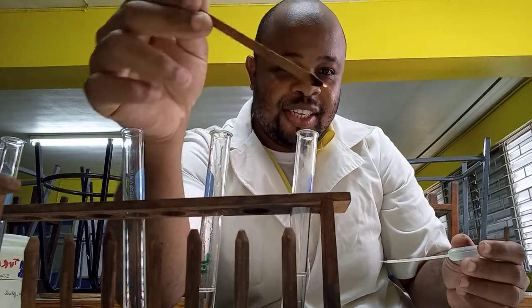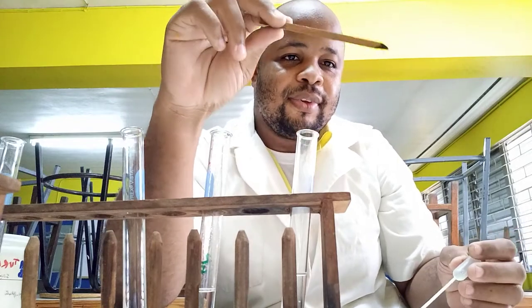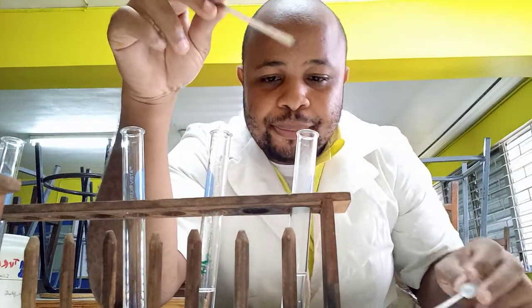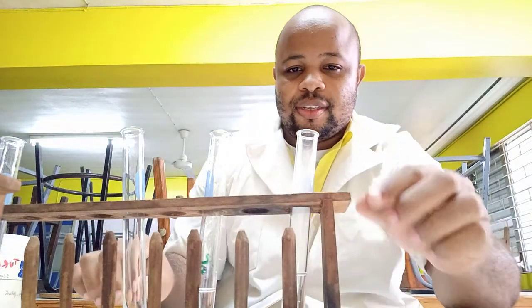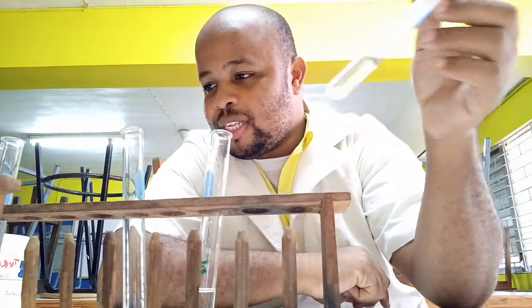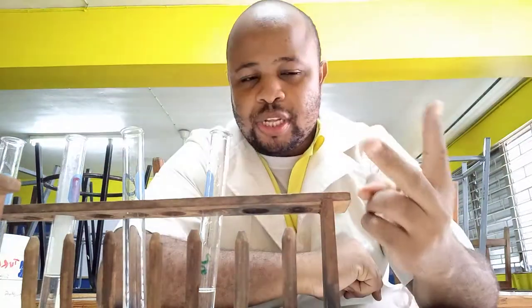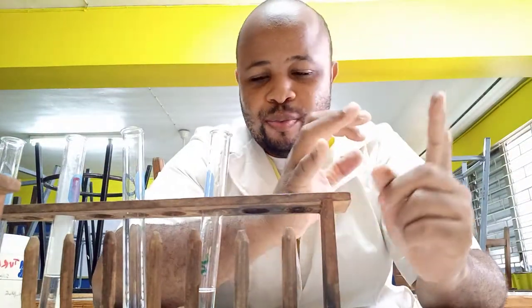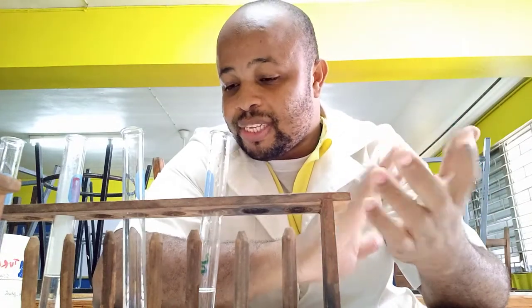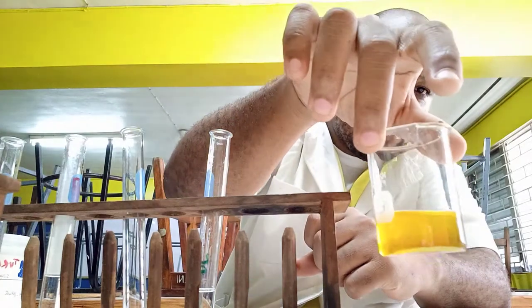As long as oxygen gas is there, the splint re-lights. It changed from purple to colorless again. That's two reactions done — we did it with alcohol and with hydrogen peroxide. The final one is with ferrous ammonium sulfate.